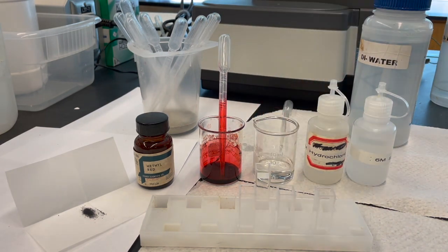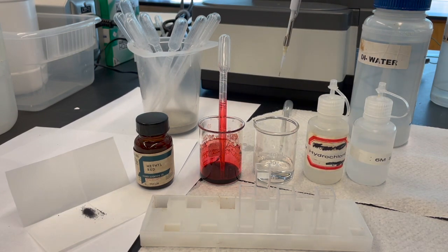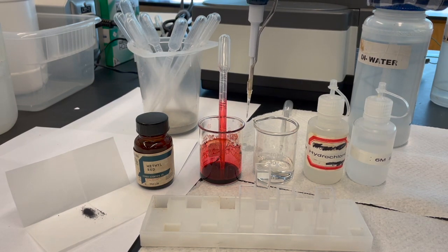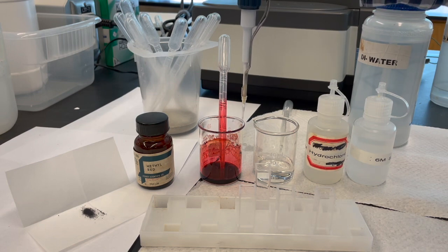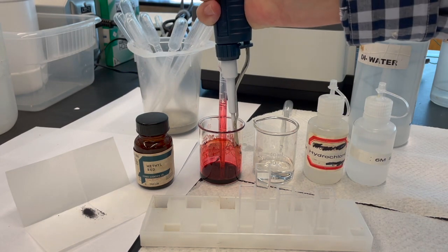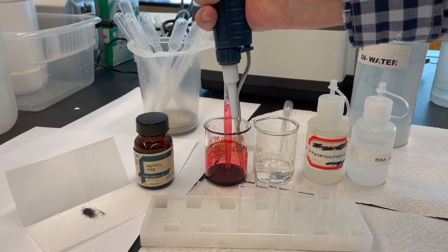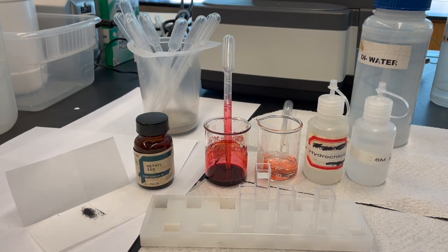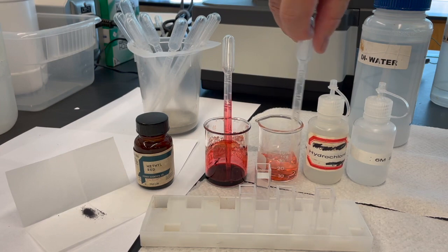And then here's the buffer that I'm going to make the stock solution in. I don't need precision with this because the concentration of dye does not show up anywhere in the actual equation for pKa that we are using today. However, just to make it reproducible so I can have several runs of this, I'm using a micropipette. And there is our diluted dye — it's going to be the solution that we use for spectrophotometry.